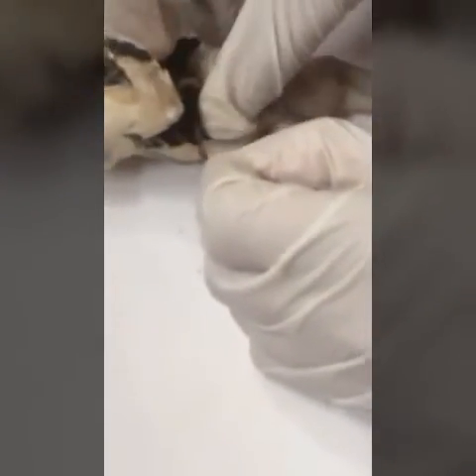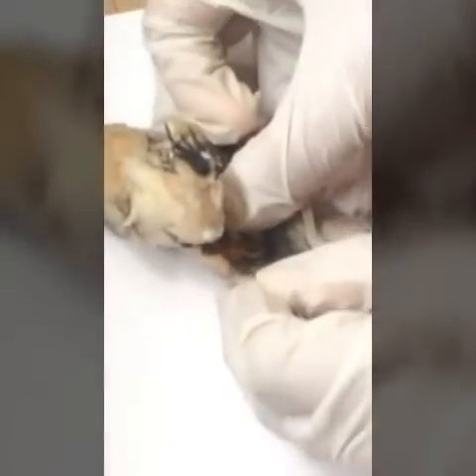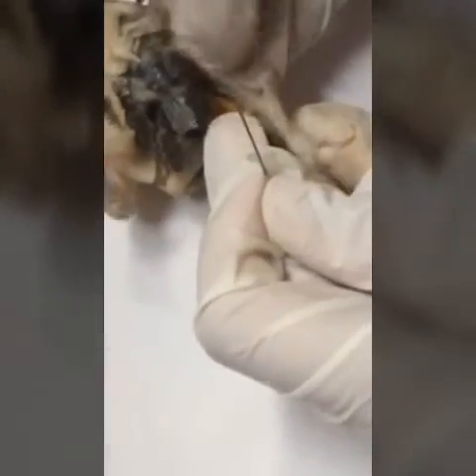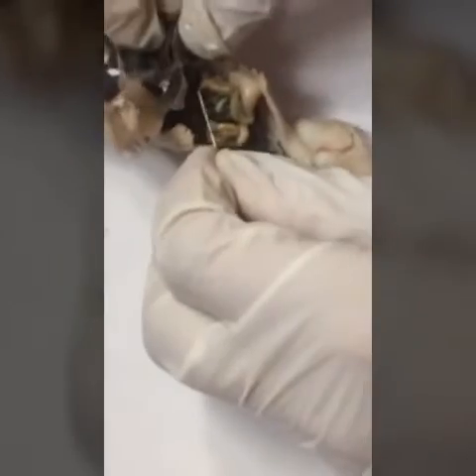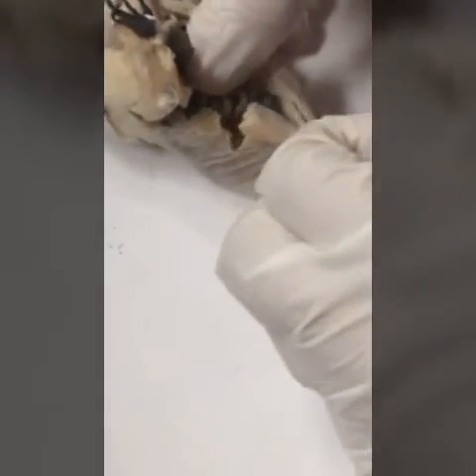Then you can see the corpora adiposa down below — the yellow part right there. As you go deeper you can see other internal organs. The pancreas is right here, down below the liver. Then you can see the testis, which is the white part right there. Then you can see the large intestine, which is down below here.